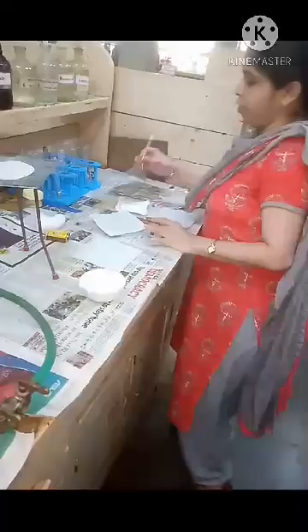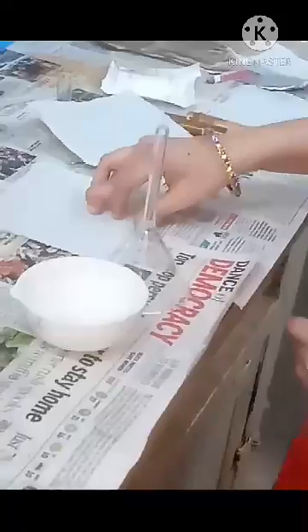Let us see the apparatus. We require a porcelain dish, a glass funnel, filter paper, a tripod stand, wire gauze, a burner for heating, and the chemical required is phthalic acid.